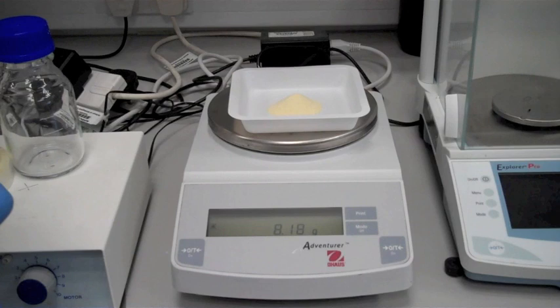That's gone slightly over, 8.1 grams, 8.2 grams, but that's okay.